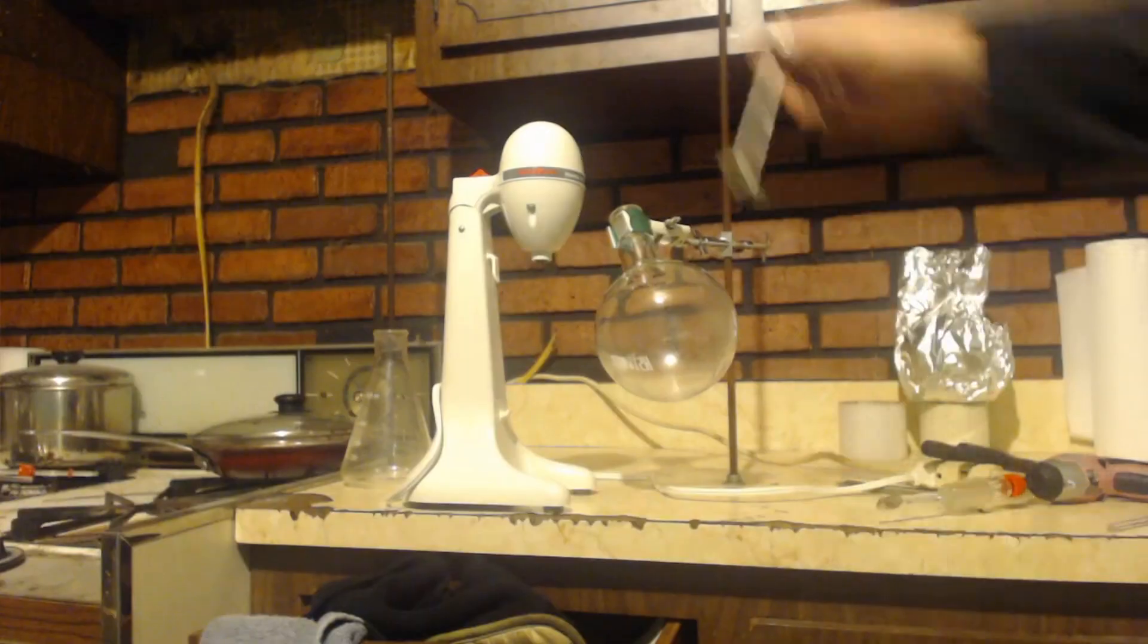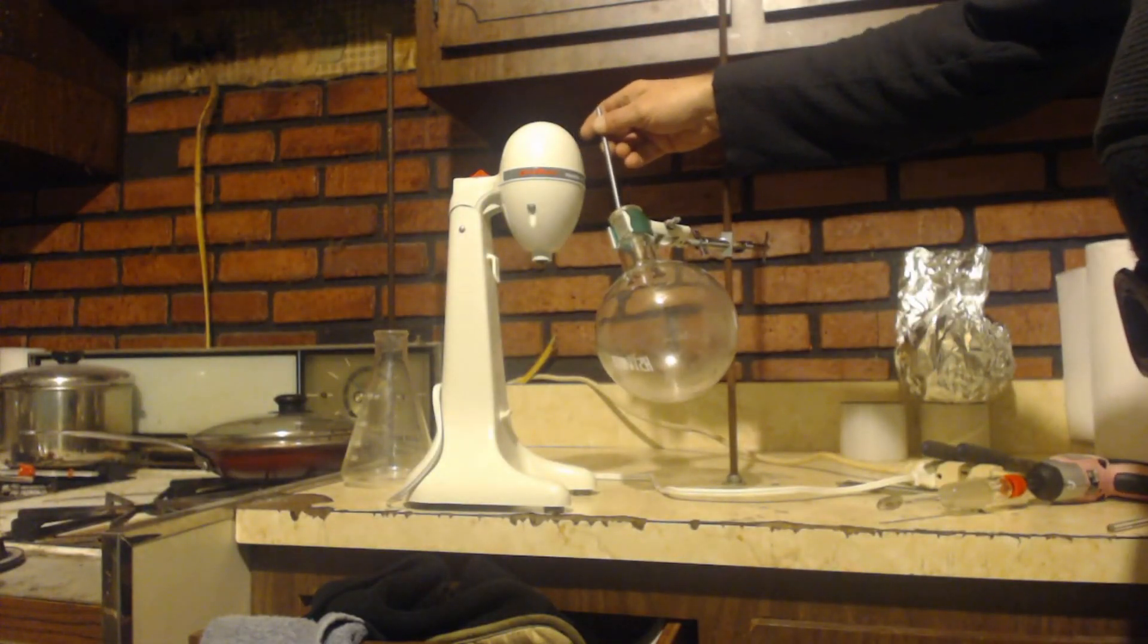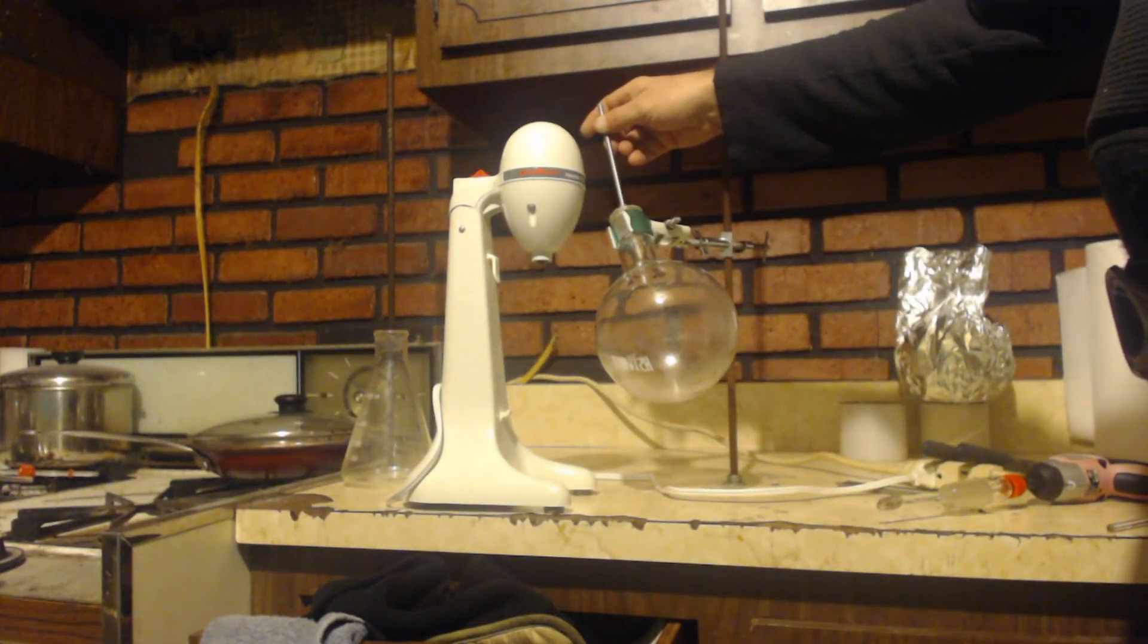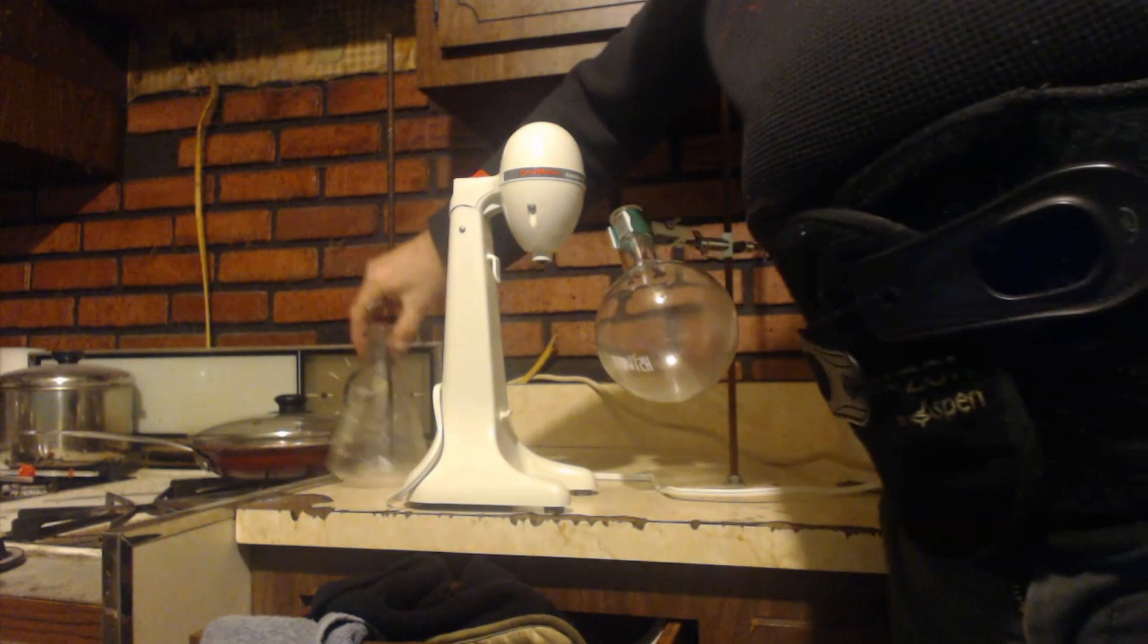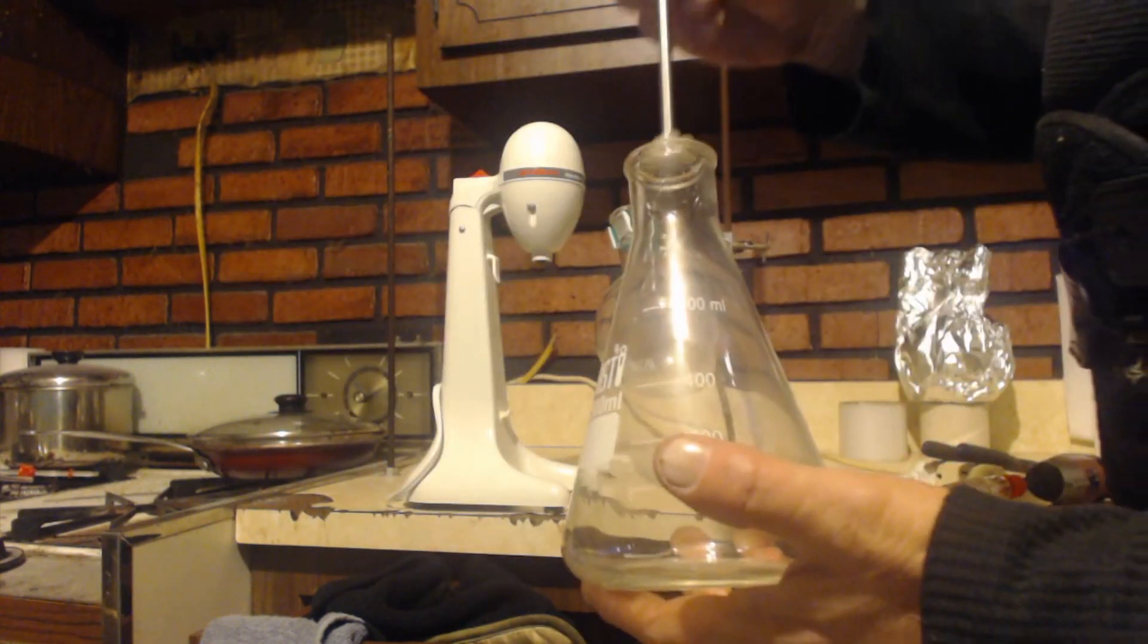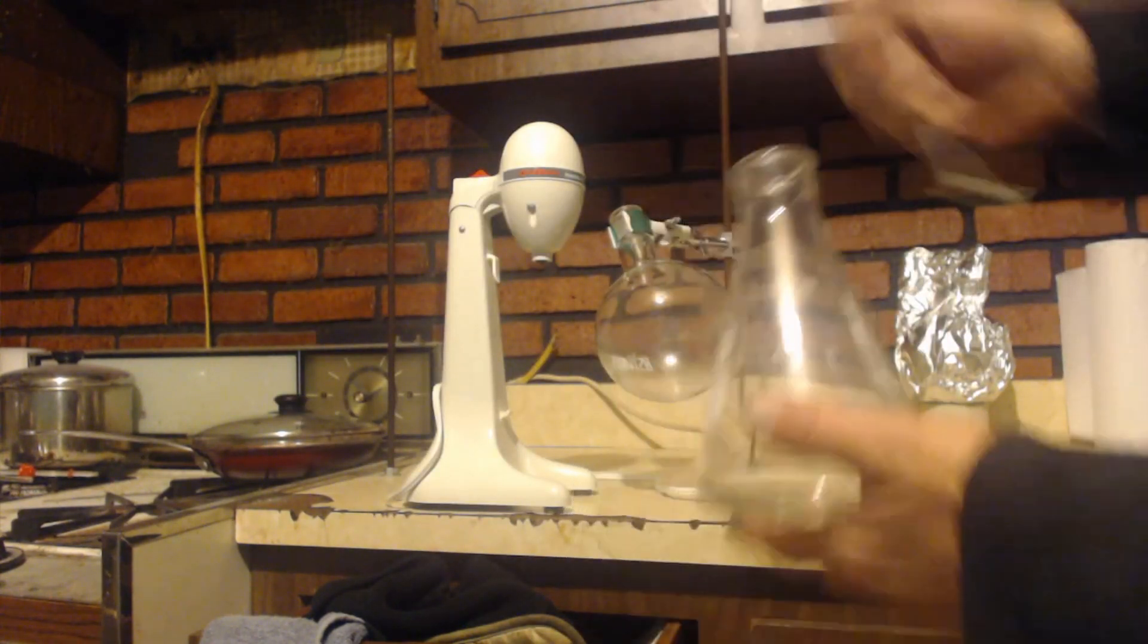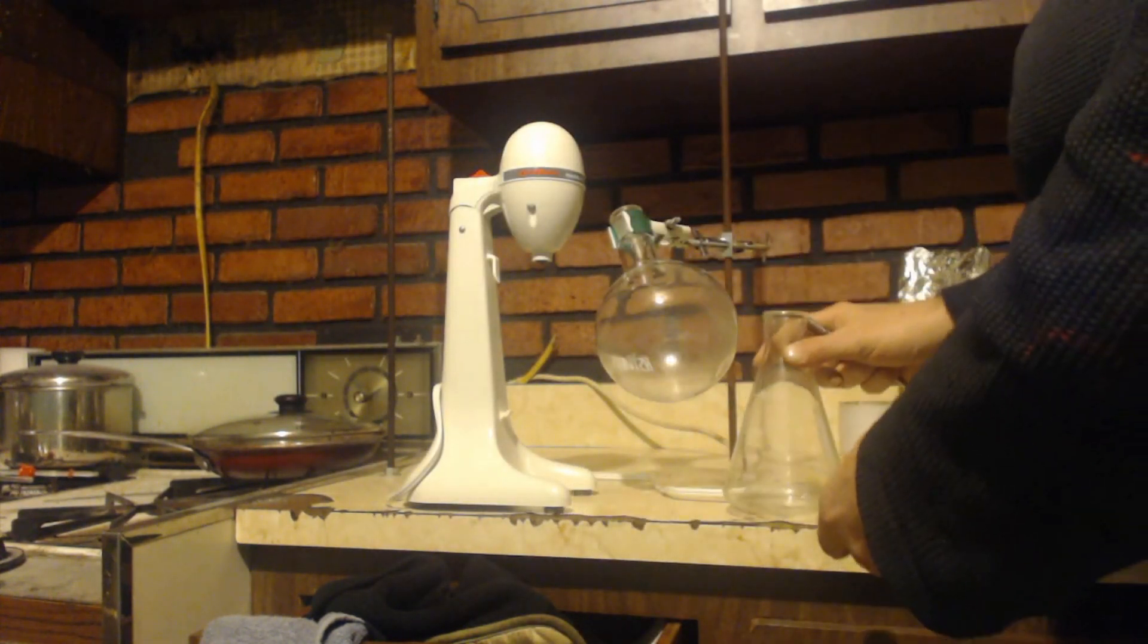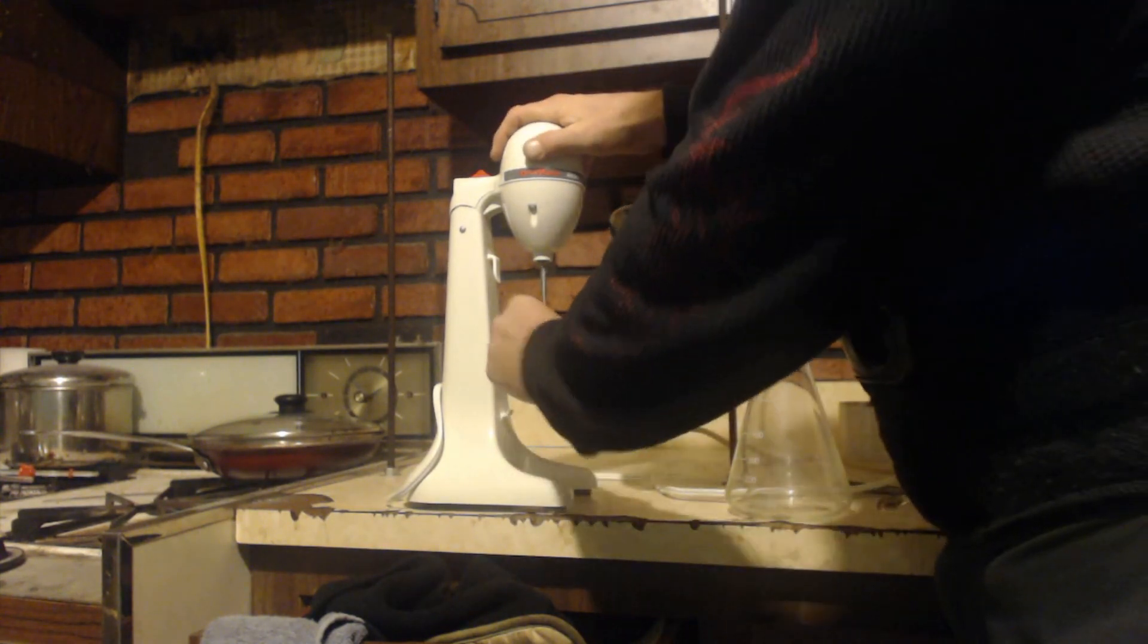And you can see, I don't see it. This won't fit into the round bottom flask, but an Erlenmeyer flask goes right in there.